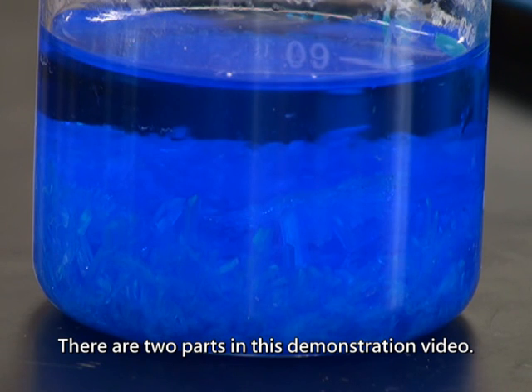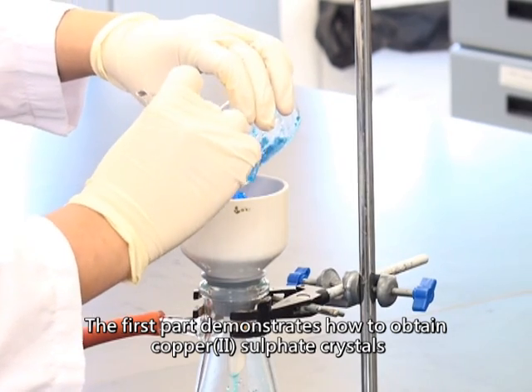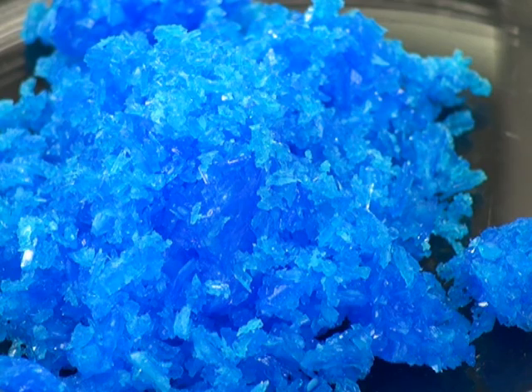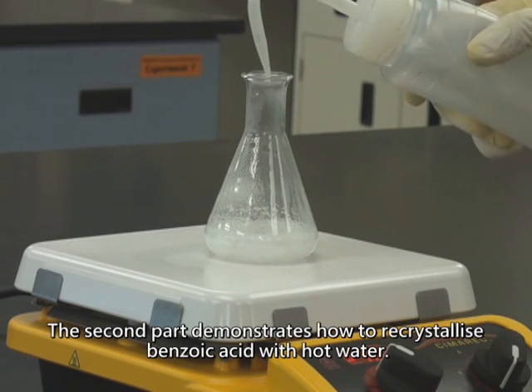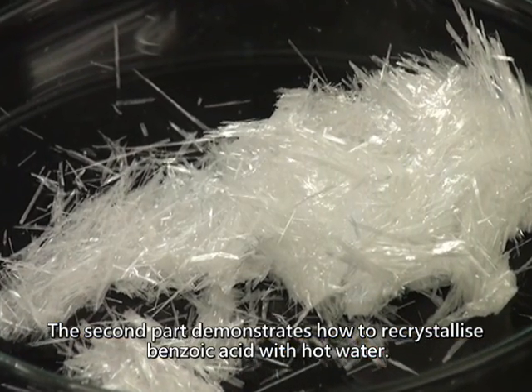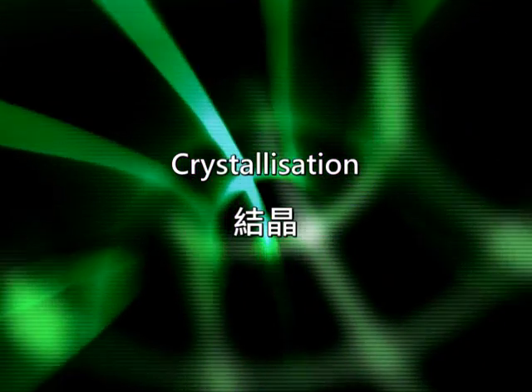There are two parts in this demonstration video. The first part demonstrates how to obtain copper-2 sulfate crystals from a hot saturated copper-2 sulfate solution. The second part demonstrates how to recrystallize benzoic acid with hot water. Crystallization.